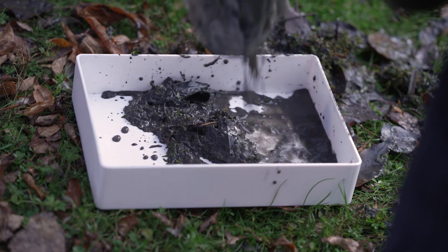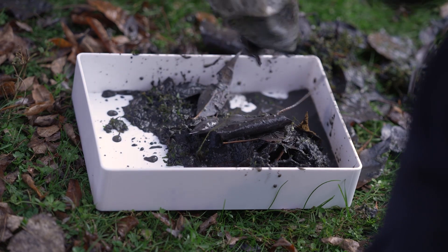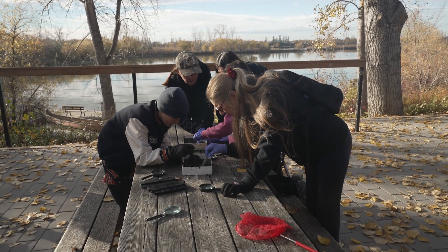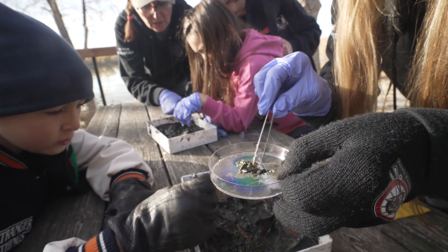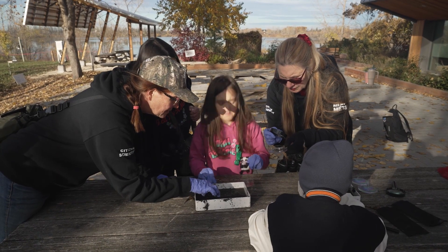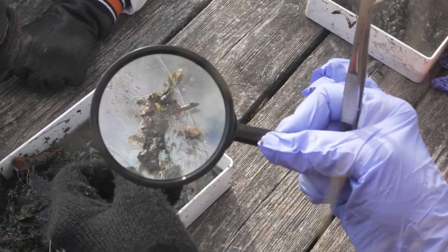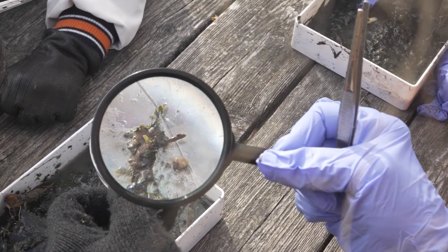Don't worry if you also get some of the muddy bottom in your sample — invertebrates live there too. Once you have finished your sweep, empty the contents of the net into your sample tray. If you have too much material for the tray, that's okay — just leave some of it in your net and sort your sample in stages. The next step is to sort and identify the wetland invertebrates in your sample. The simplest way to separate the invertebrates from debris and sediments is to pick them out by hand. Start by removing larger materials such as vegetation, pieces of wood, or rocks from the tray. As you remove these materials, carefully inspect them for clinging invertebrates, placing any invertebrates you find back into the tray for collection.